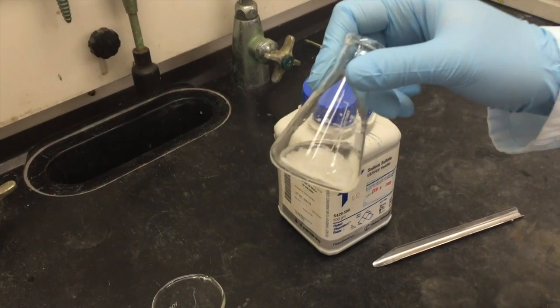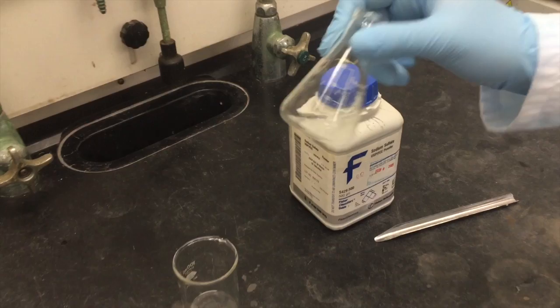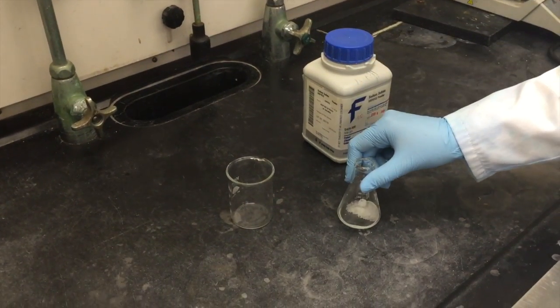You will know when you have added enough when you see the snow globe effect. The sodium sulfate will rise up and fall back down like a snow globe.